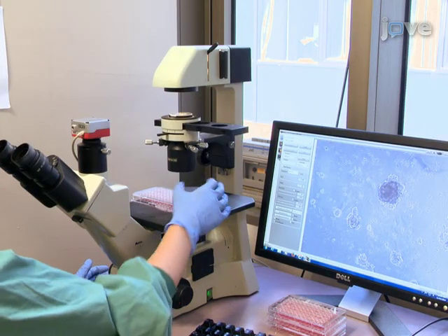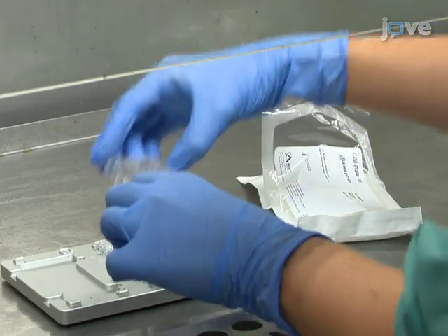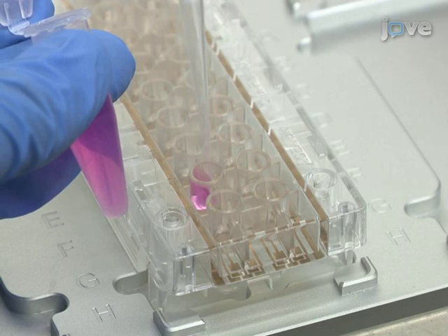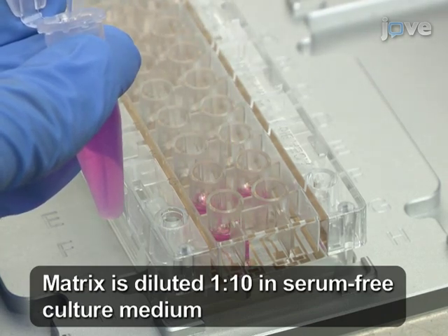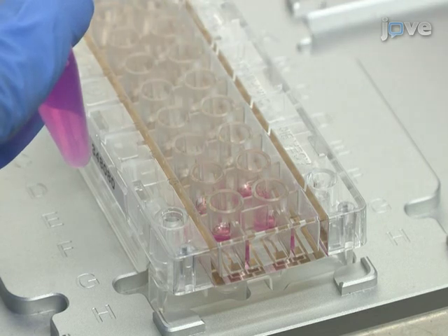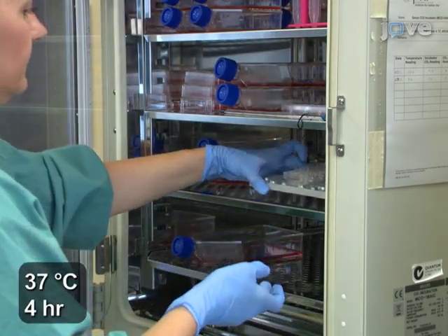Typically one spheroid per well is observed. The real-time cell analyzer, or RTCA, cell invasion assay utilizes a 16-well RTCA two-chambered CIM plate. Working in groups of four wells at a time, add 50 microliters of matrix to each well of the upper chamber of the plate to ensure that the total surface area is covered. Remove 30 microliters of matrix immediately but slowly to get rid of any excess fluid.